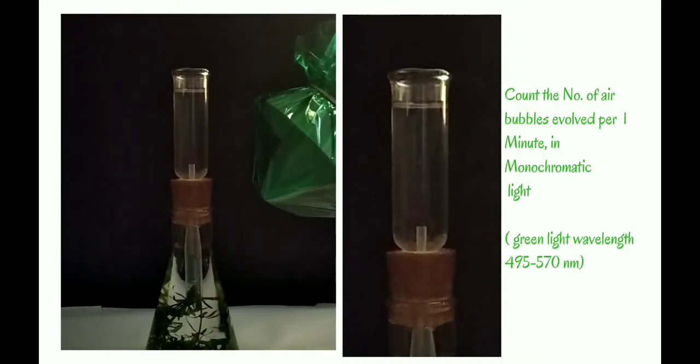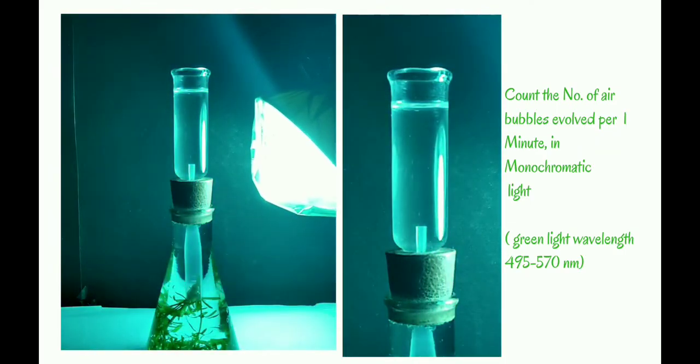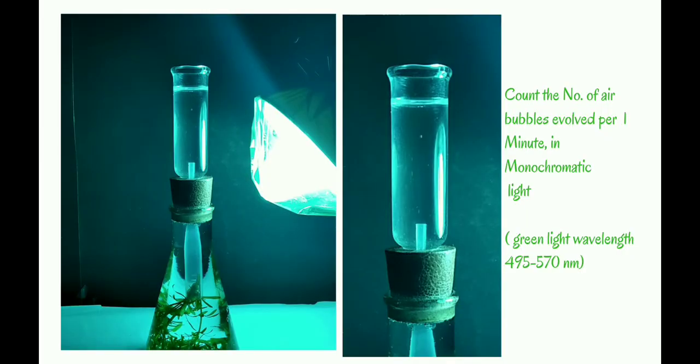The fourth and final setup is green color light of wavelength 495 to 570 nm. Here the air bubble formation is very less, sometimes it is nil.